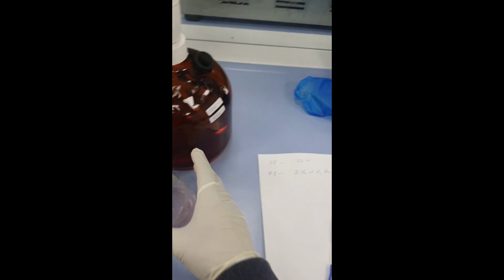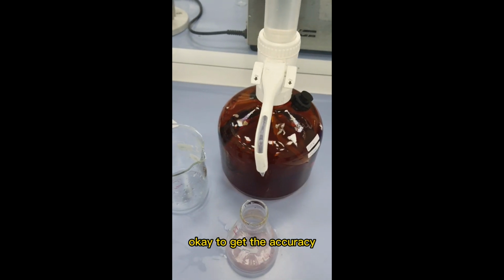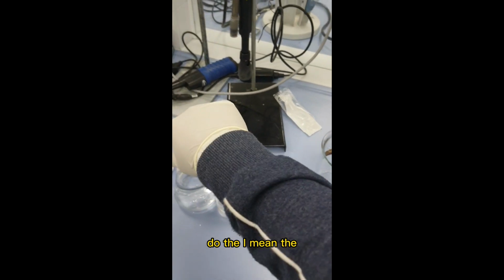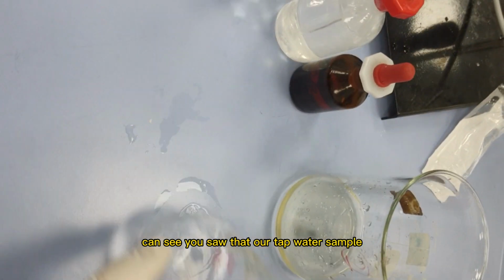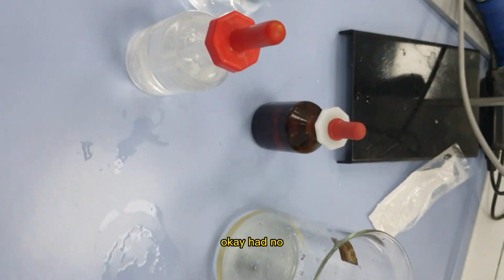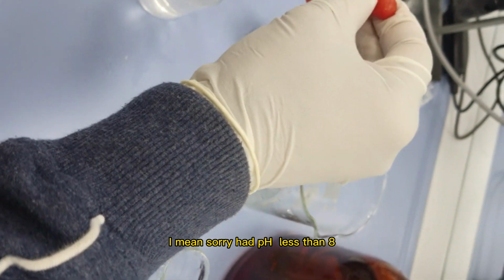Now we can repeat to get the accuracy. Now I would do the analysis for the second sample. You saw that our tap water sample had pH less than 8.